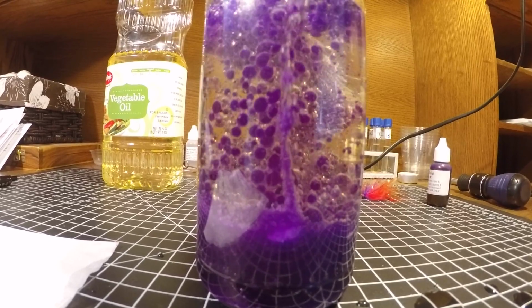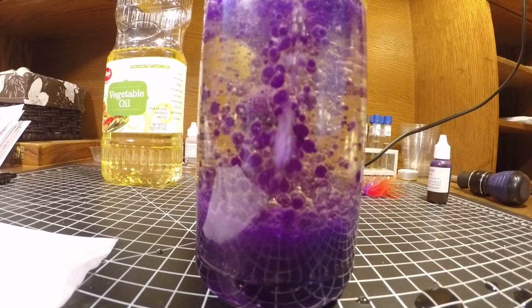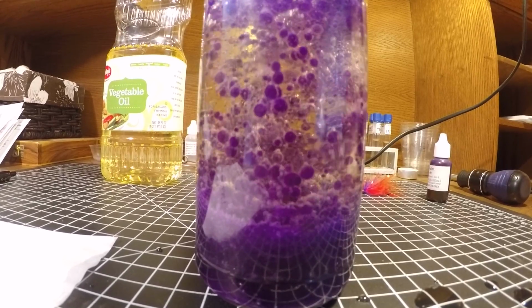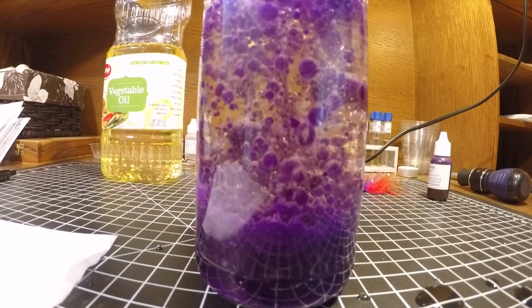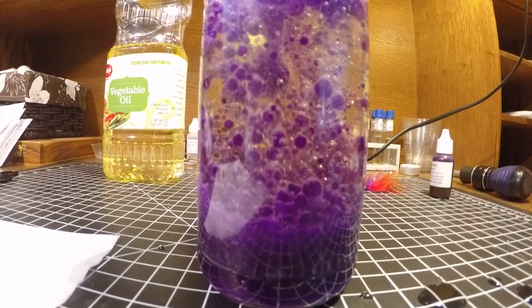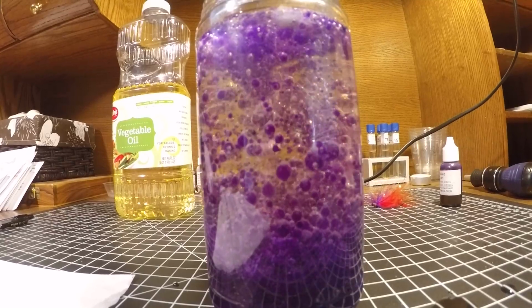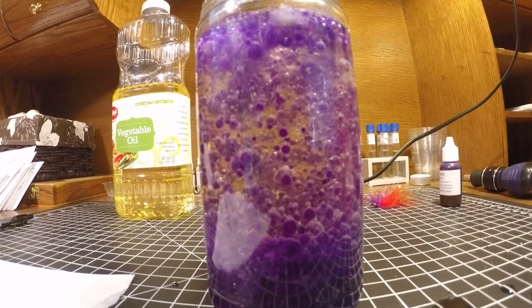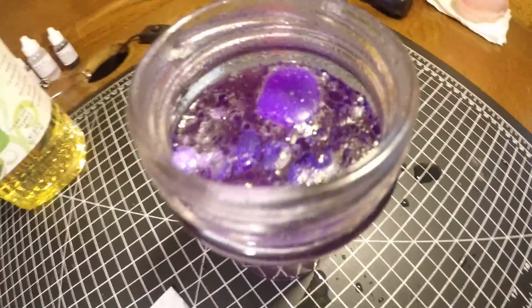As the acid and the base, the citric acid and the bicarbonate, go together and produce some water, some H2O, and the carbon dioxide as a gas, the gas is releasing, which is what you'll observe from the top.